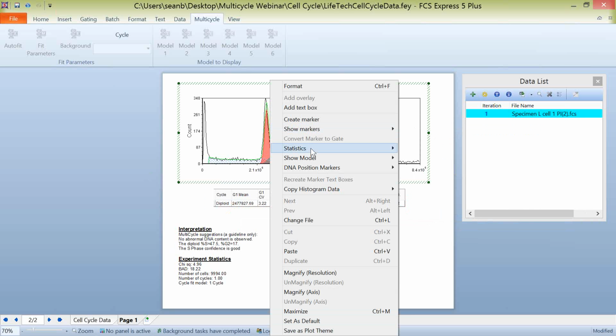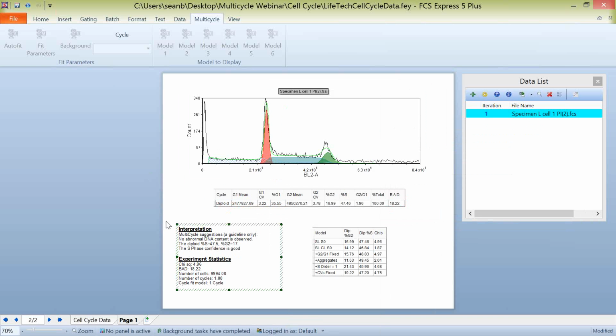Now, our statistics here for DNA experiment statistics are located here on the bottom left. This is essentially an interpretation of the data by Multicycle. And you can see here it says that this is a multi-cycle suggestion. This is just a guideline only. So this is a basic look from a software perspective about what's going on with your data. It's saying that there's no abnormal DNA content in here. There is diploid percentages here, and here's our S phase confidence. And in this case, with this particular model, it's pretty good.